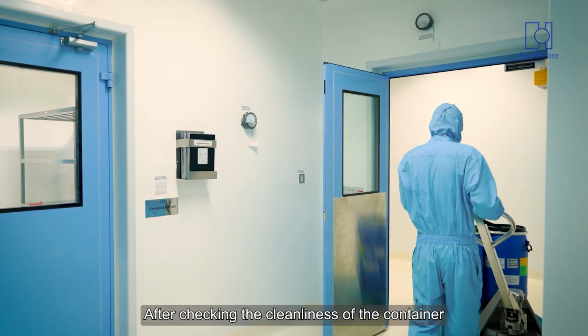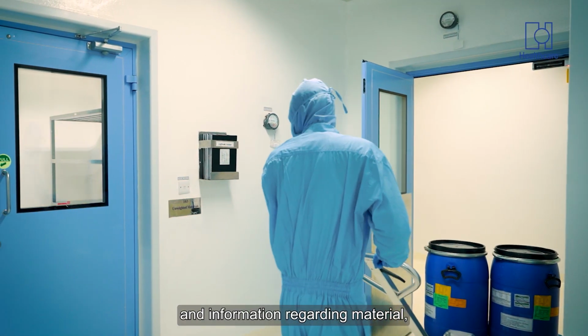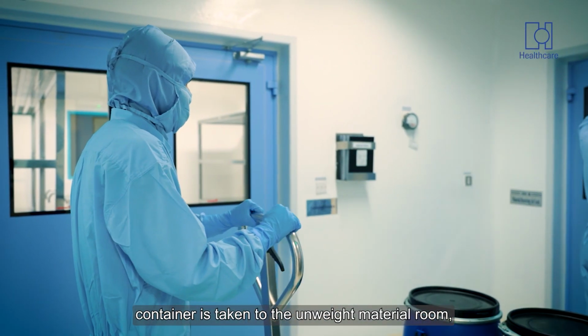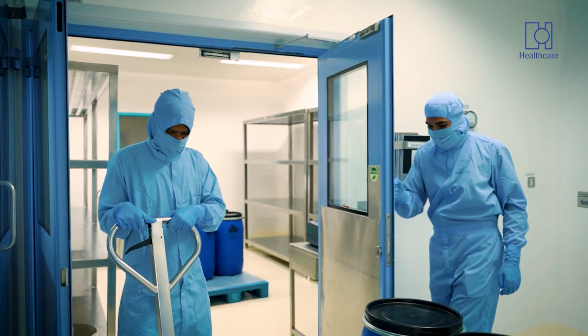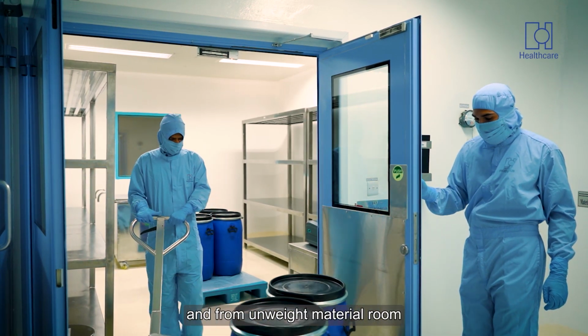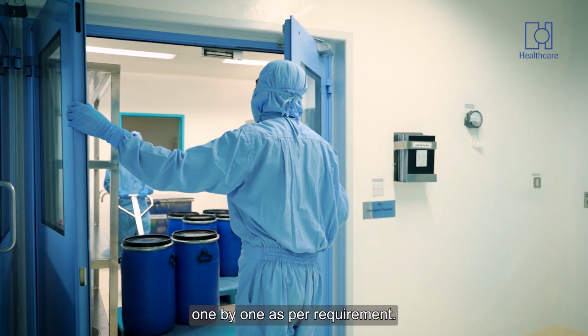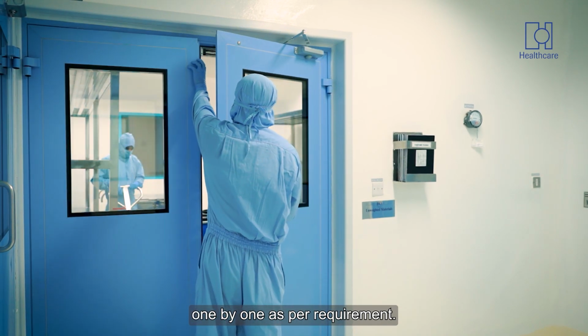After checking the cleanliness of the container and information regarding material, the container is taken to the unweighed material room, and from the unweighed material room it will be taken to the dispensing room one by one as per requirement.